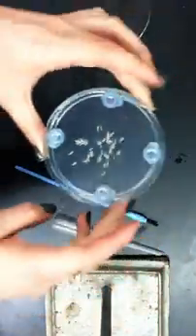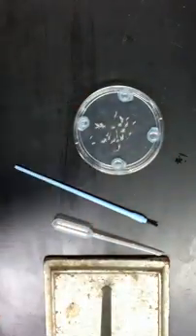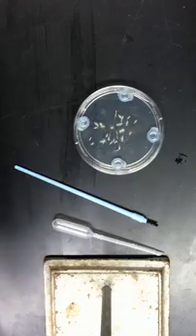And now they're all placed in the center of the fructose plate. AM is in all four tubes. You put the top on it, and wait five minutes until testing.